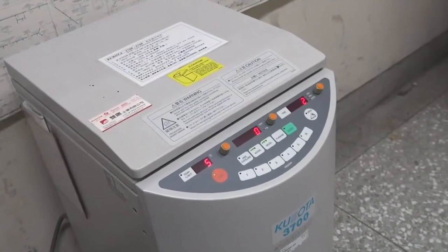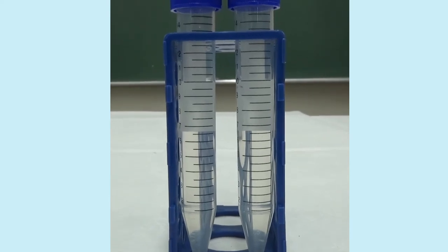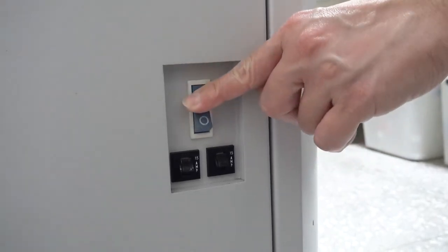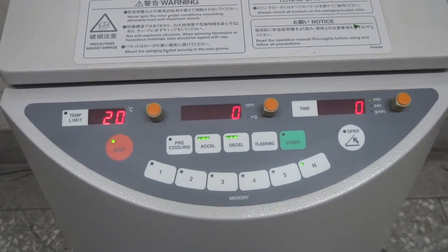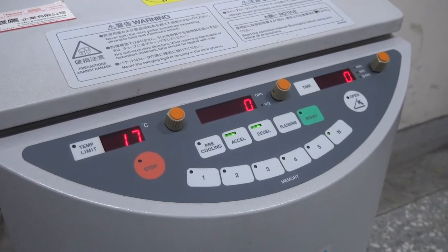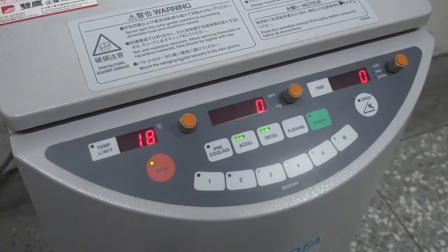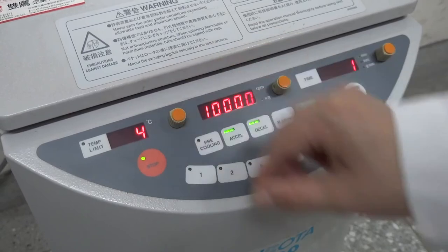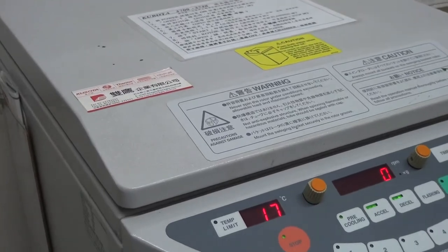A floor-standing high-speed centrifuge will now be demonstrated. It is usually designed for relatively larger amounts of samples. Plug it into the electrical outlet and turn on the power button if there is one. The device will start the self-test procedure automatically and can be operated after passing the self-test. Some devices have a sound prompt function after centrifugation has been completed. If low temperature is required, the centrifuge must be set to pre-cool to a certain temperature. Remember to close its top lid to maintain low temperature.